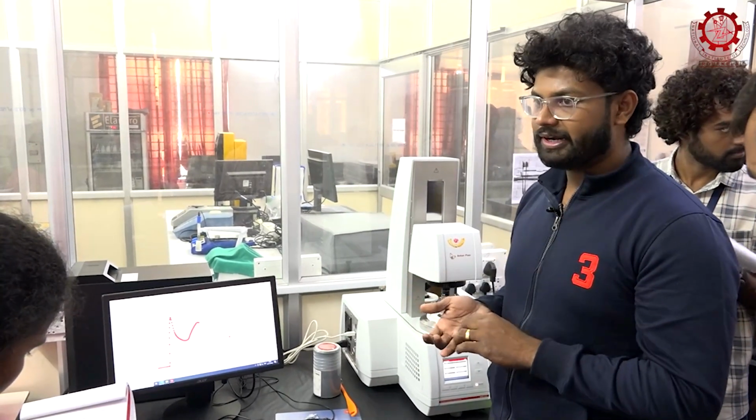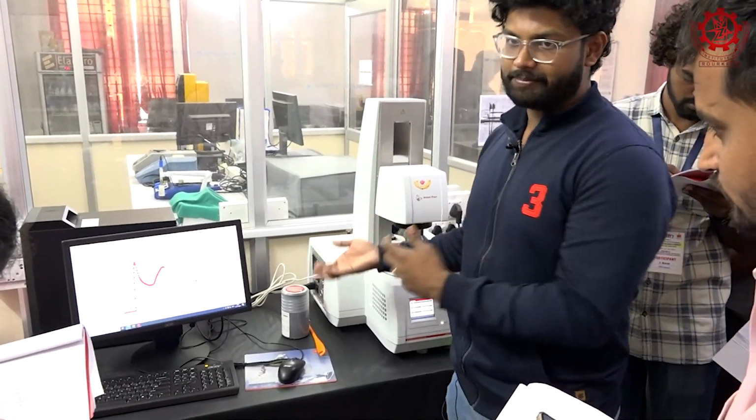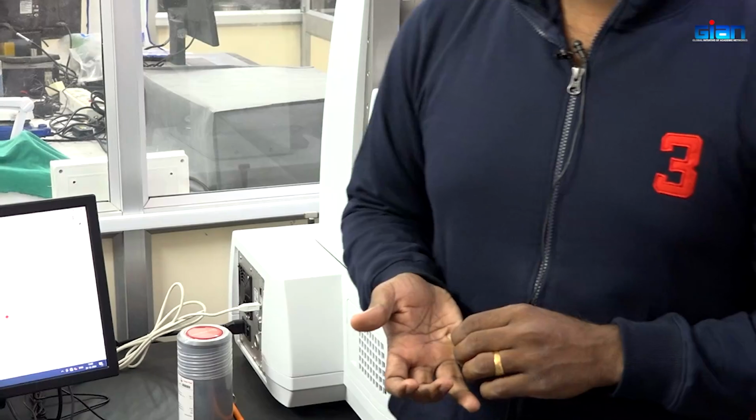So it will be running for the next 23 minutes, and after that you can note down the readings for our sample. Okay.